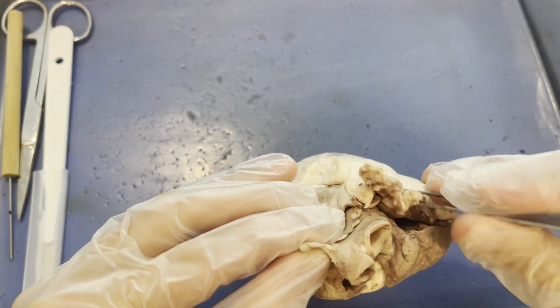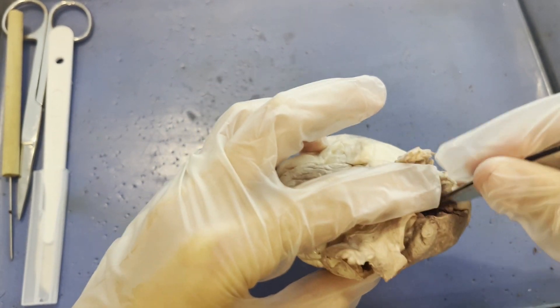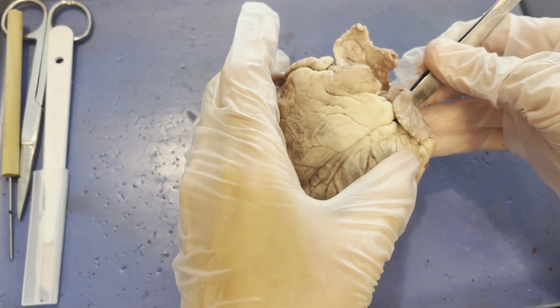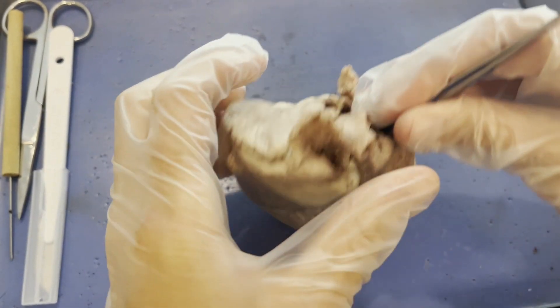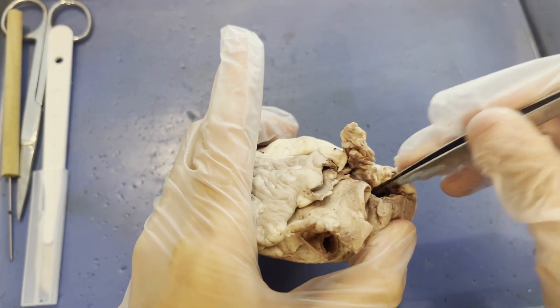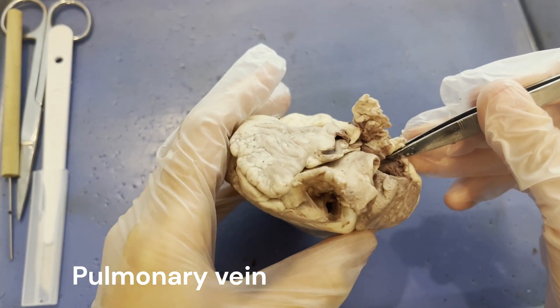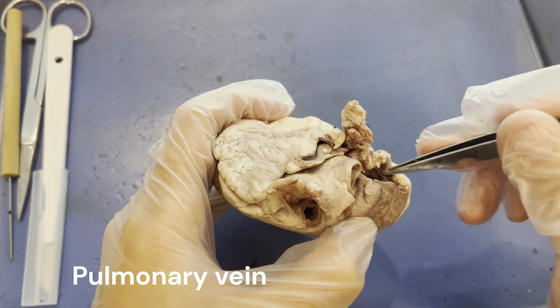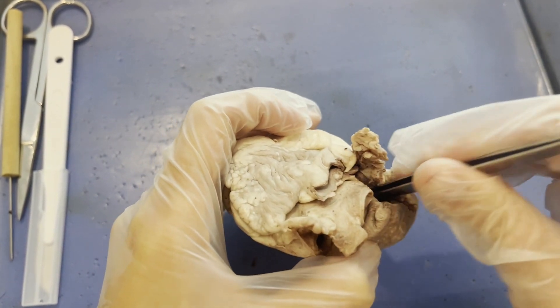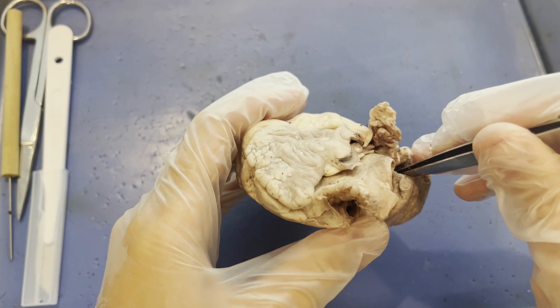That blood returns back to the heart oxygen-rich. You can see it dumps blood right in here into the left atrium — this right here is the pulmonary vein, or what's left of it. It drops off right here, dumping oxygen-rich blood directly into the left atrium.